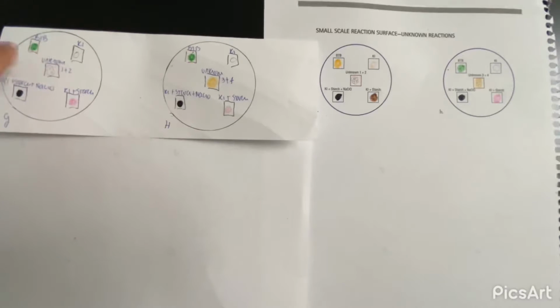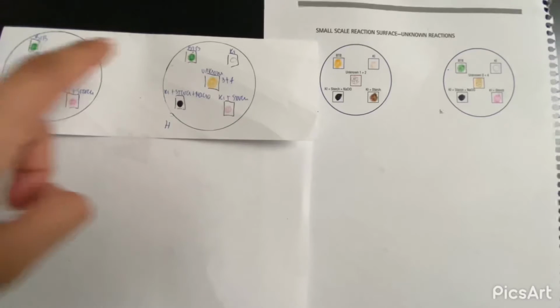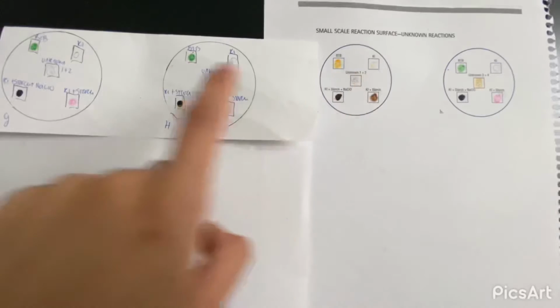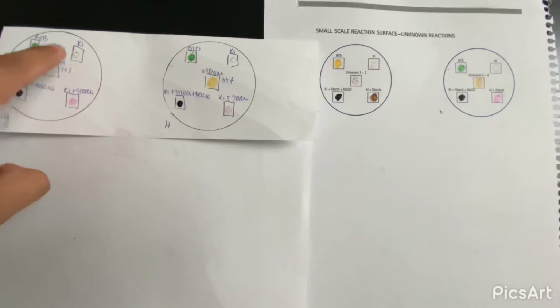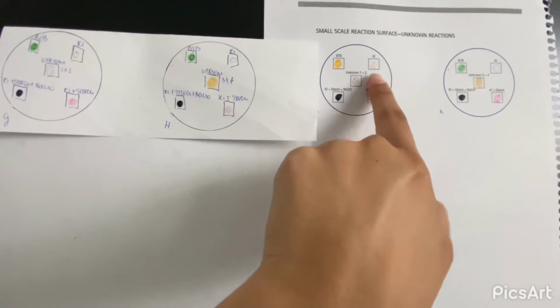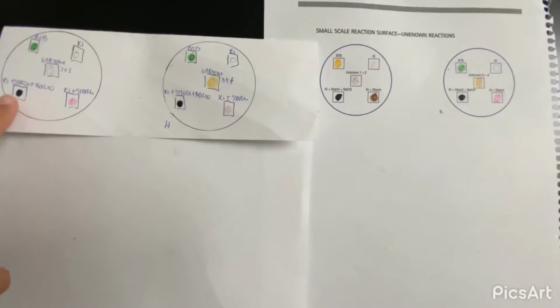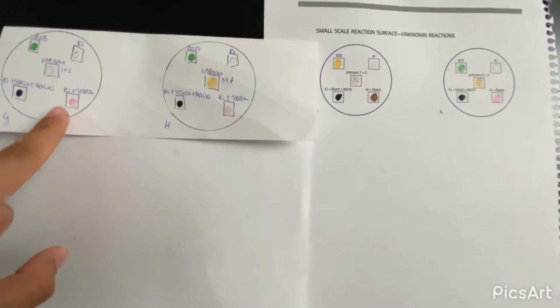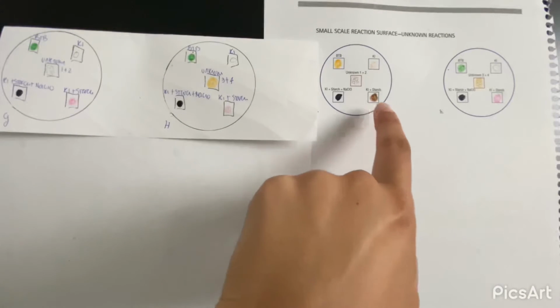Our BTB starts green, and after the incubation we have a strong yellow-orange color. Our KI is colorless, but after the 5 minutes we can see it's light pink. The KI starch and the NaClO keep the same color, no change, dark black. And then for the KI starch, it's pink and ends up being brown.